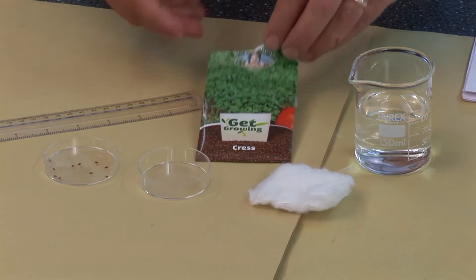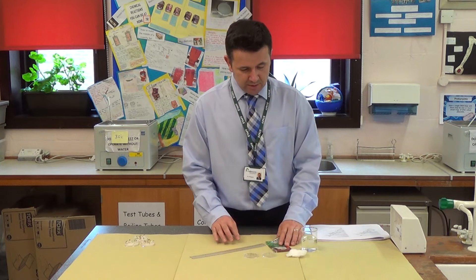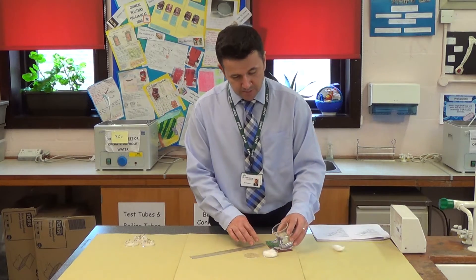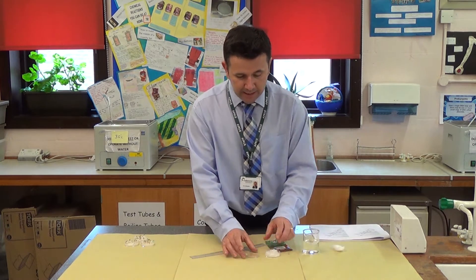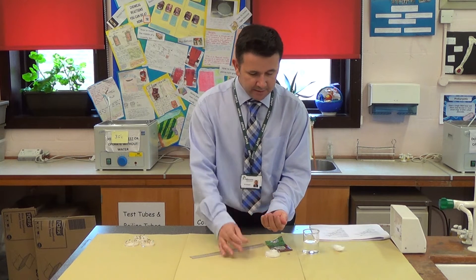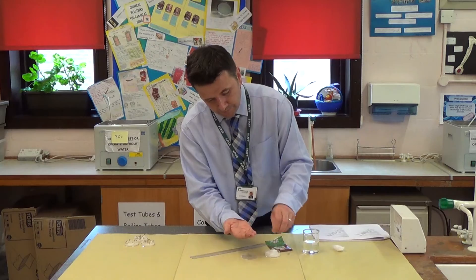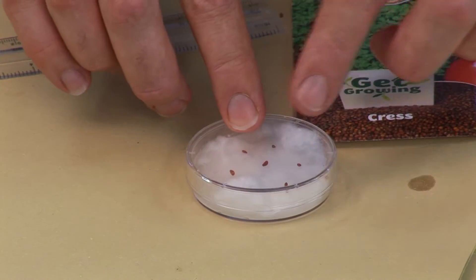As you can see, we've got the apparatus here. I've measured out 10 cress seeds separately in the Petri dish. First you're going to need some cotton wool, which you place into the bottom of the Petri dish, then add some water just to make it damp — don't put too much water in. Then you add the 10 cress seeds, making sure to place them at roughly equal distances so that they have enough space to grow. Once you've finished, put your Petri dish lid on and label it.